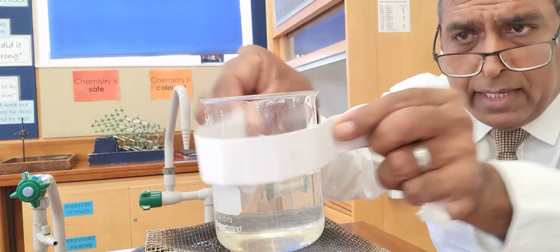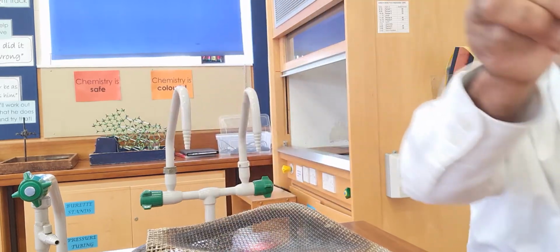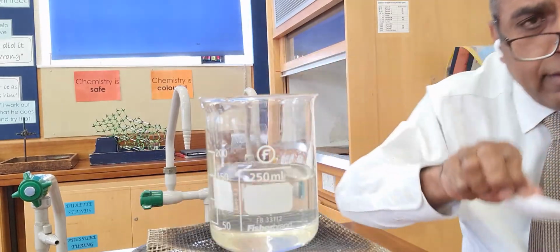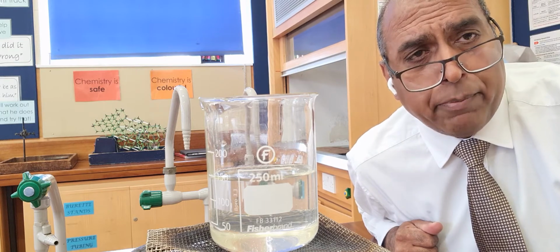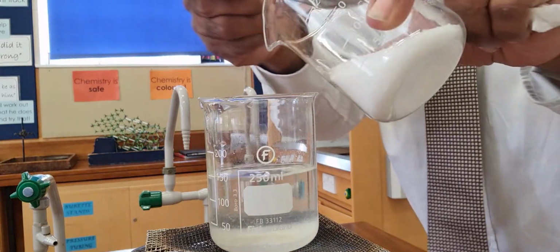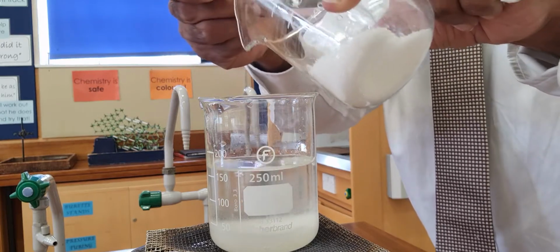Now, I've made this makeshift beaker holder, and I can lift this using that, like that. Can you see? You see through it. If you can see through it like you can, then we know 5 spoonfuls of sugar have dissolved. So how many more should I put in? Let's go for 6, 7, 8, 9, 10, 11, 12.